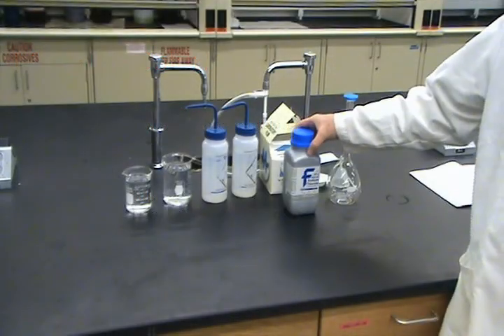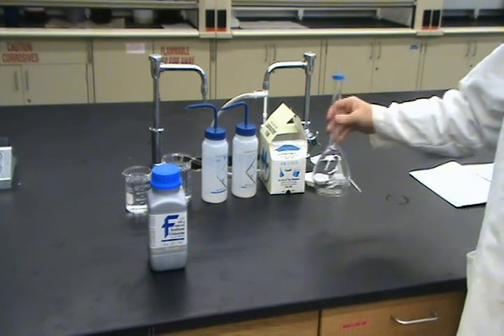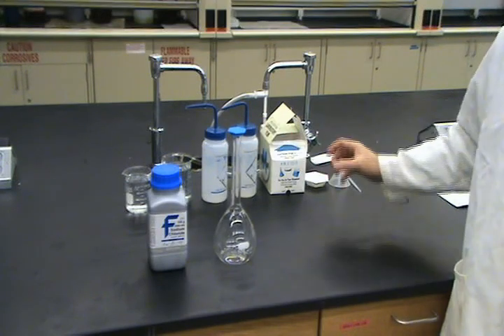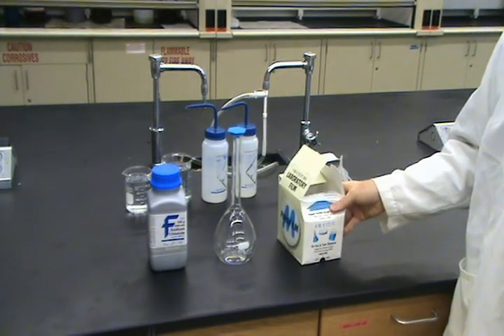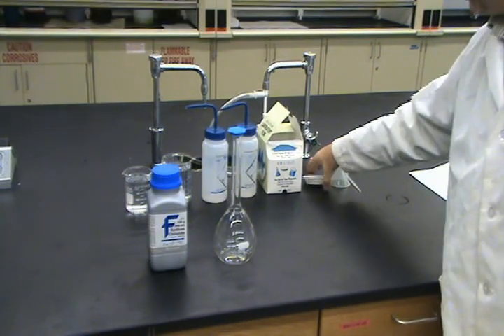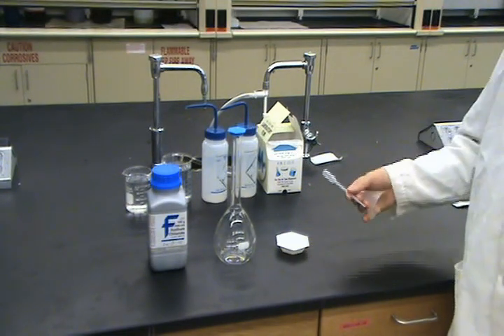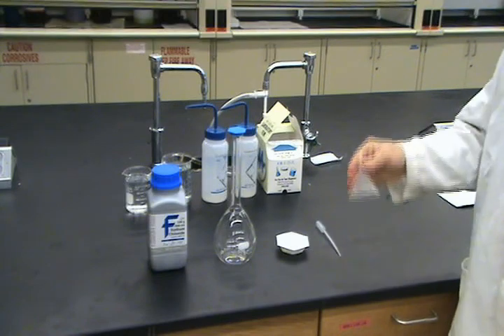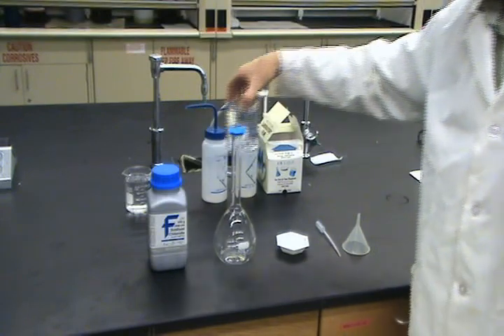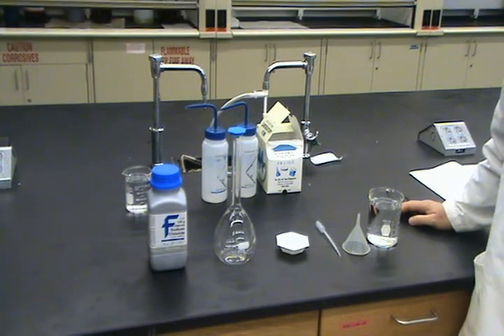Today we have to gather sodium chloride, a 500 mL volumetric flask with a cap. If you don't have a cap, you could also use parafilm, but today we're not going to use that. You also need a weighing boat. Two other things you need: a small pipette and a funnel. And of course, to make the solution, we need H2O, and today we're going to be using distilled H2O for water.